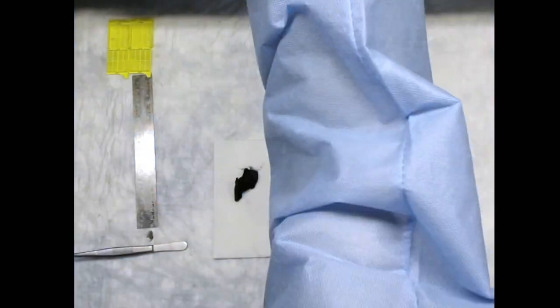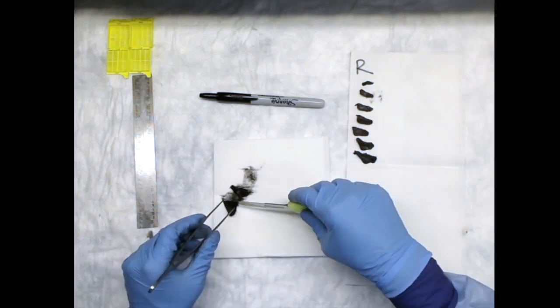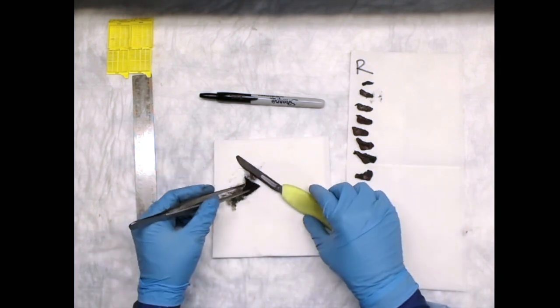For encapsulated lesions, the entire capsule should be submitted for histologic evaluation. Always measure any lesions in 3 dimensions and correlate your gross findings with any prior FNA or frozen results.